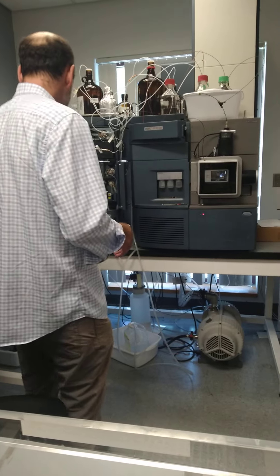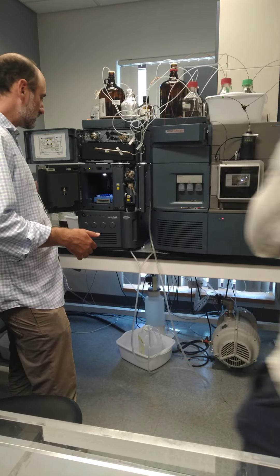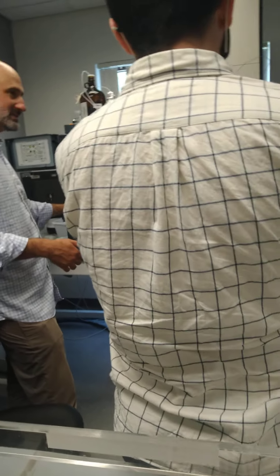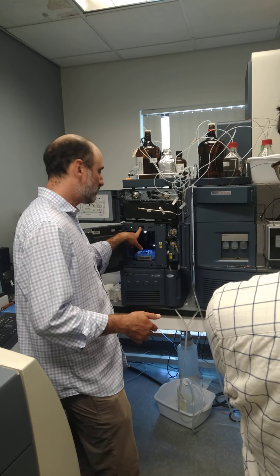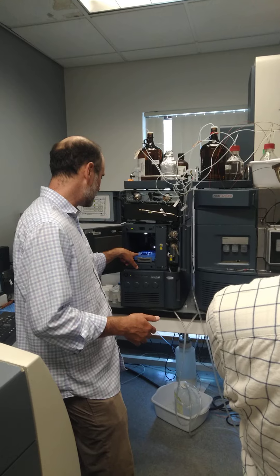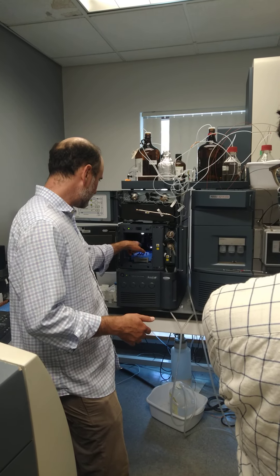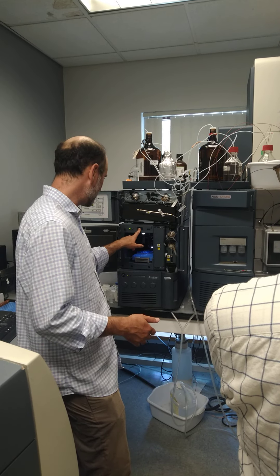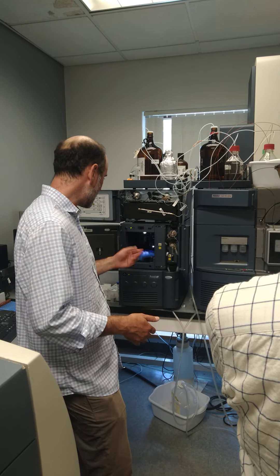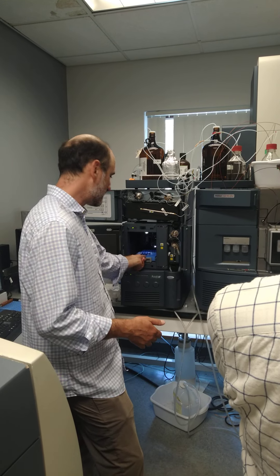This is your sample manager where you load samples. You open the sample manager door. The first thing to know when loading samples is you want to make sure that you use this button to switch between plate one and plate two. Right now we're on plate one, and that's plate two back here. When you switch, you use a different button to go to plate two, and go back to plate one this way. I prefer people not to pull the plates out — just click them back in.